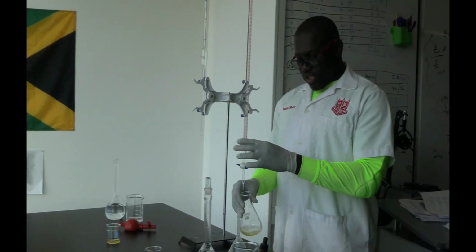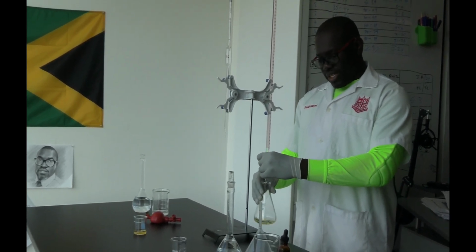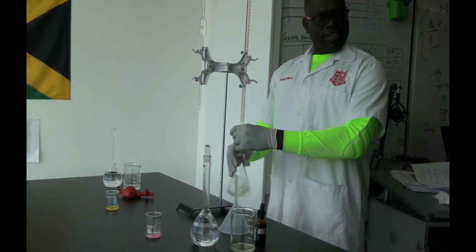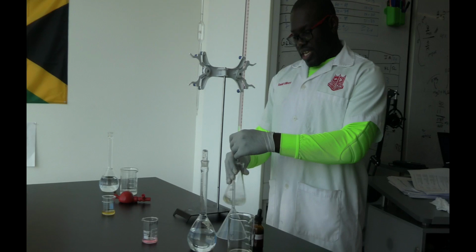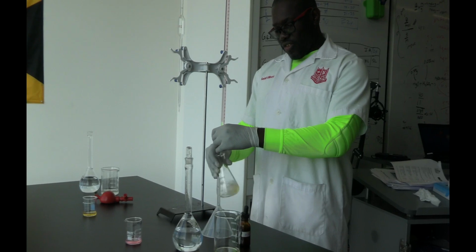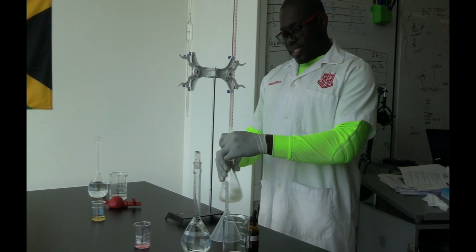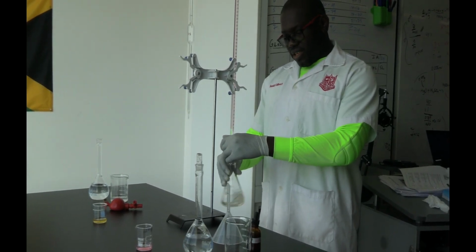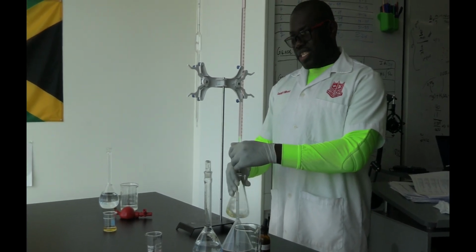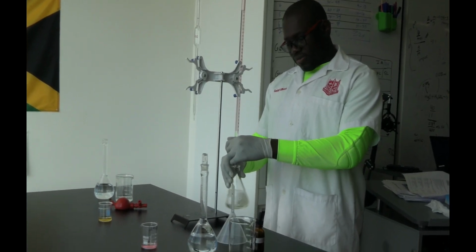Some people prefer to turn the burette around and have the valve on this side, while others prefer to have it over on this side. So now we titrate. So my solution is being added to my conical flask, and I'm swirling continuously because I'm trying to mix the reactants together thoroughly so that they react as best as possible. This can be automated using something like a magnetic stir bar, so you don't have to be swirling like this. Or there are other things that you could use to do the stir, but manually this is what we're going to have to do.